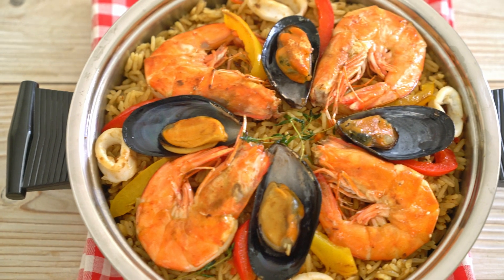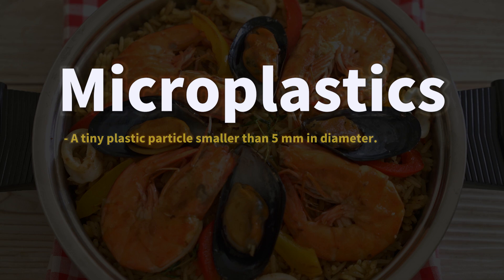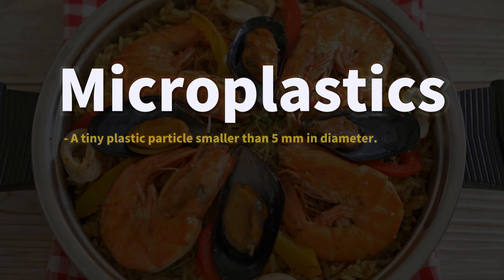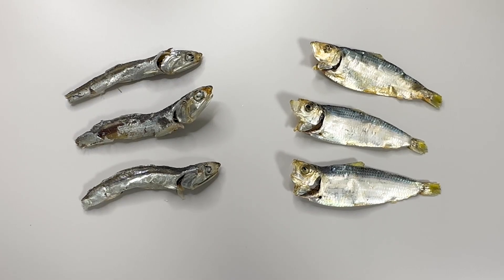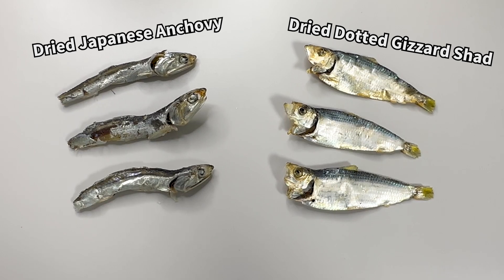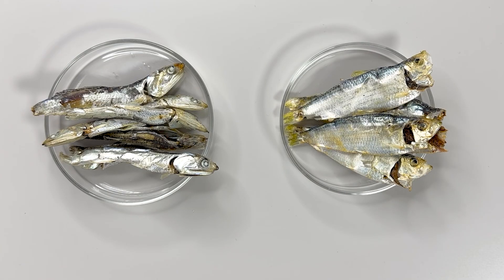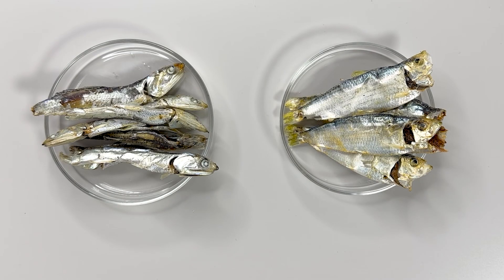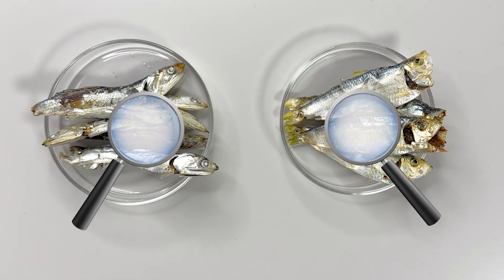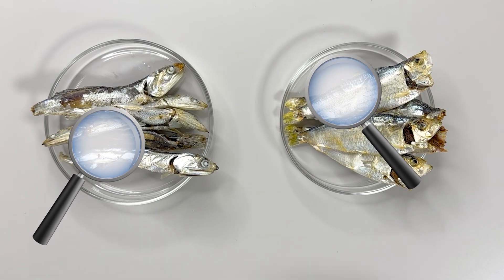Today, we've prepared small dried fish used for soup stock and dry roasting, to check for microplastics in the seafood we consume. The method to find microplastics is straightforward: simply examine the contents of their digestive tracts.